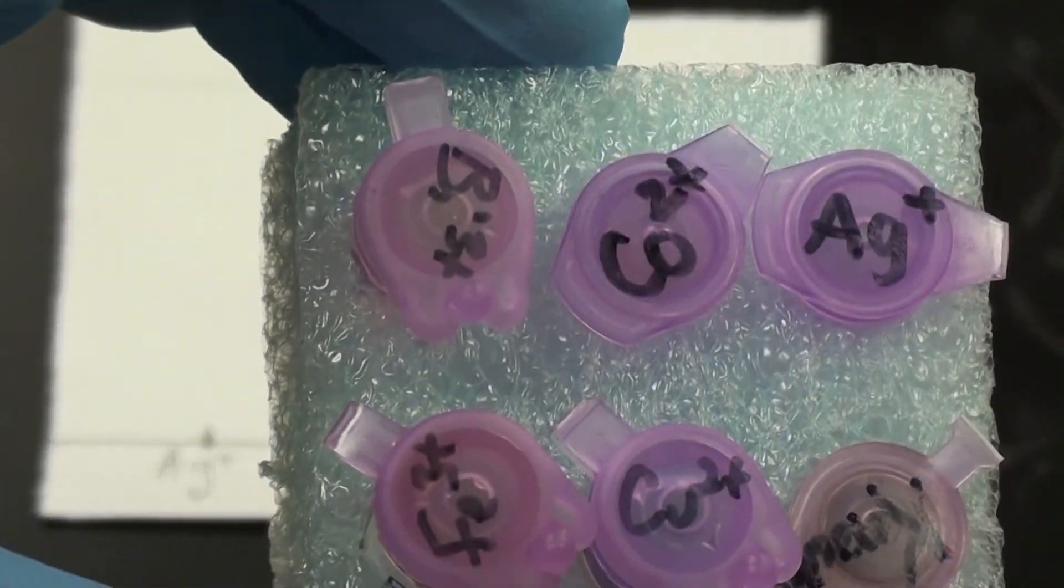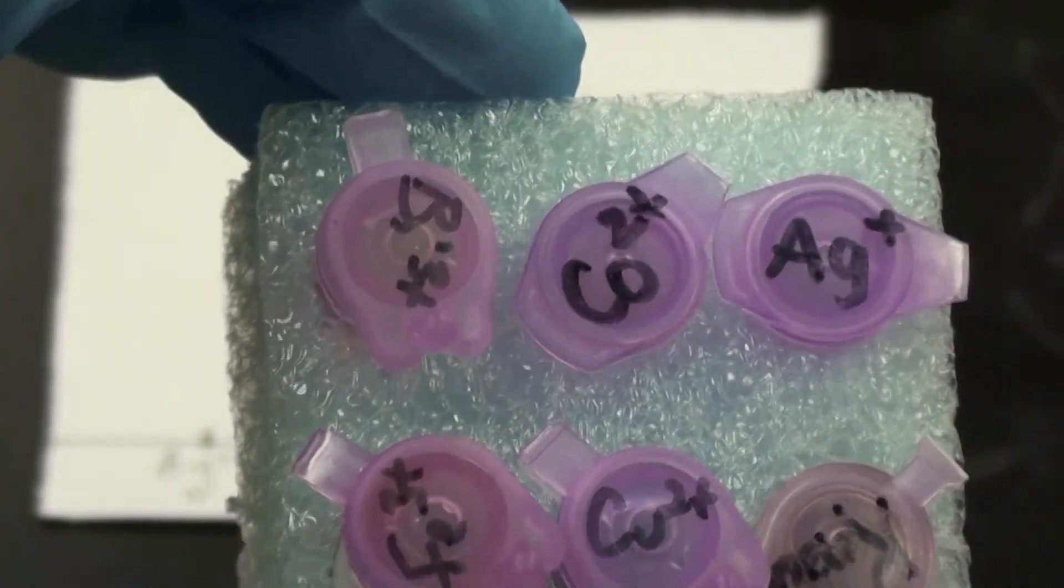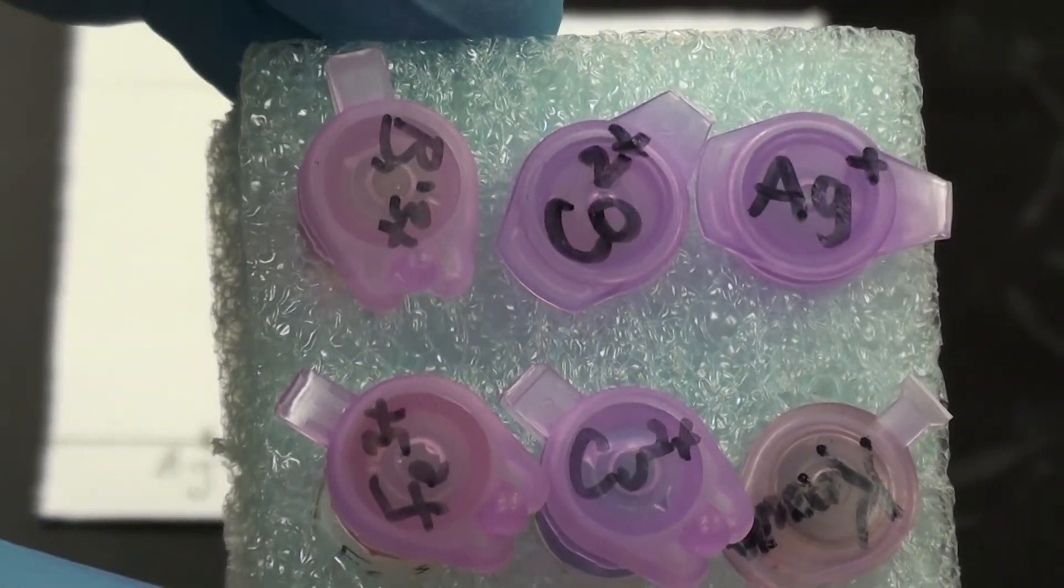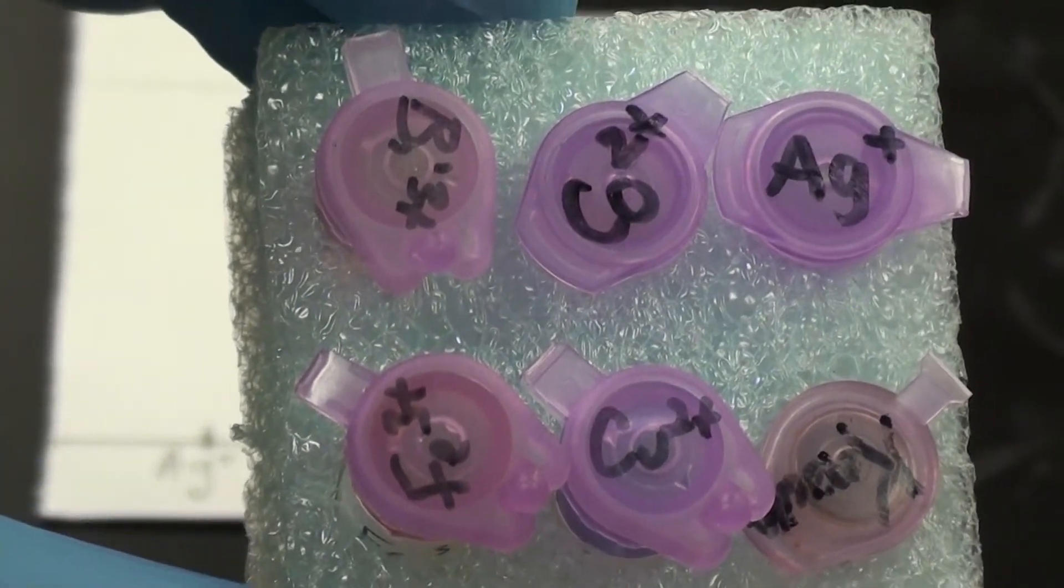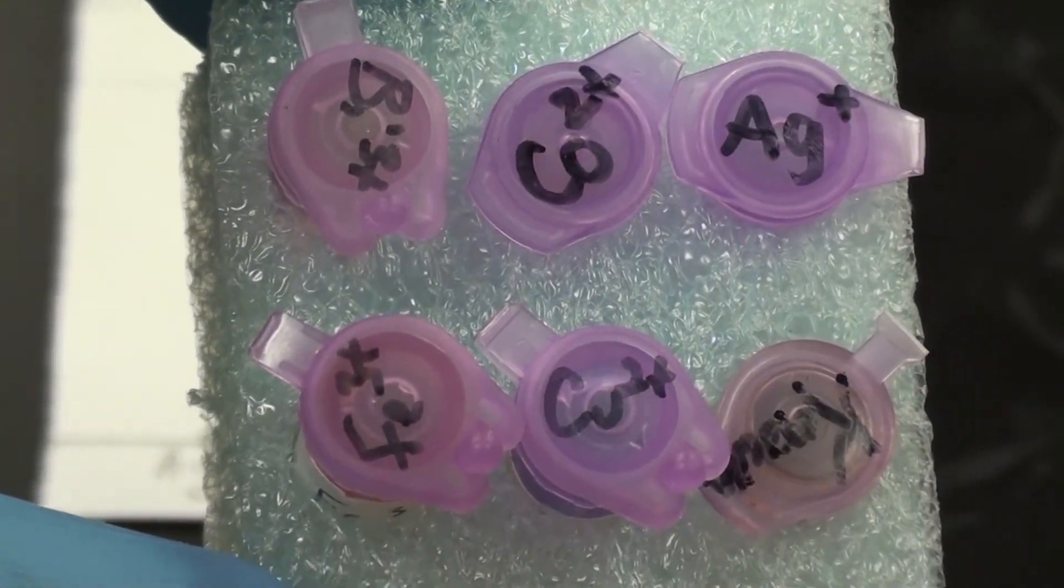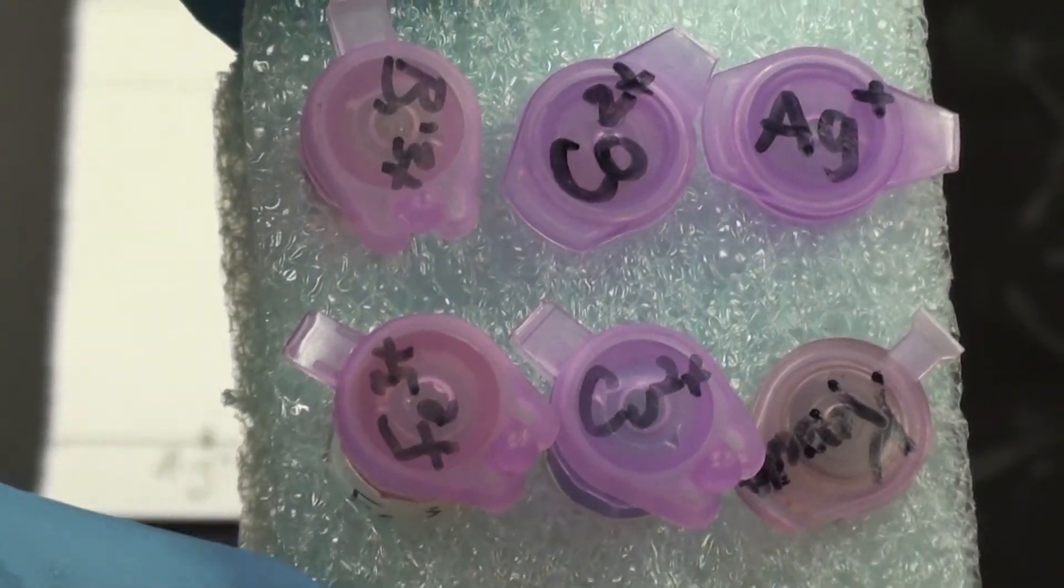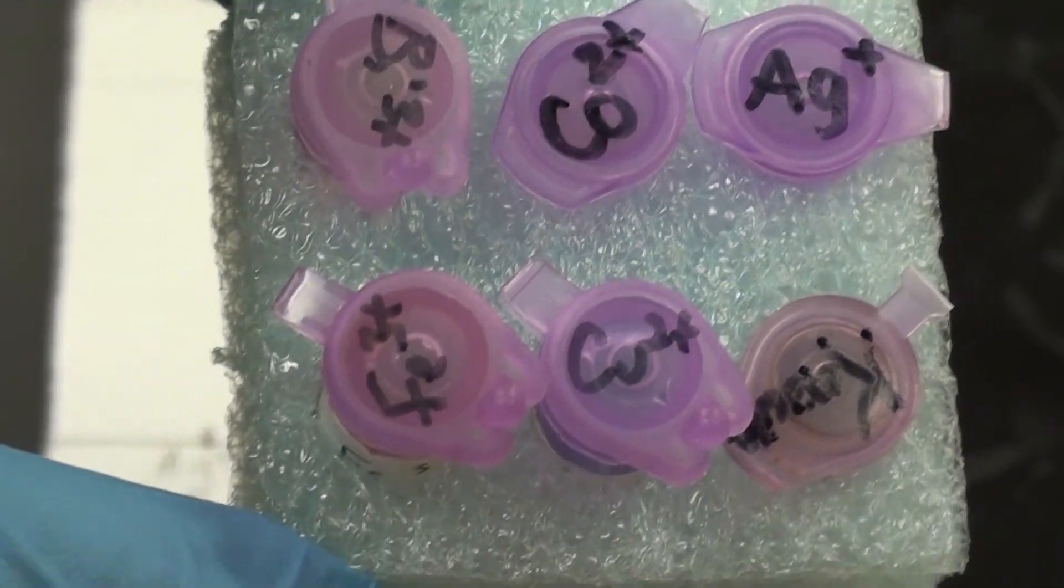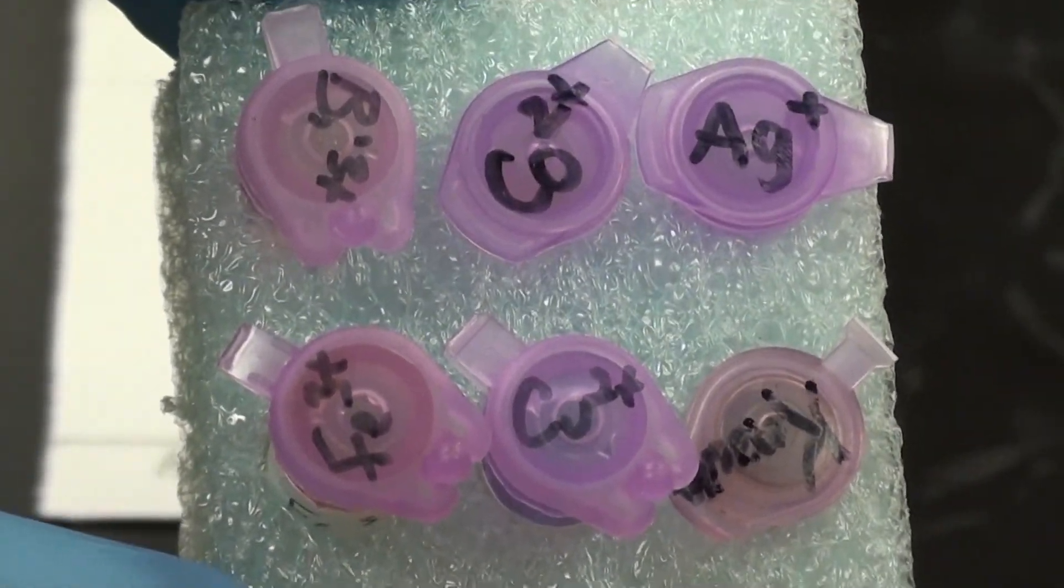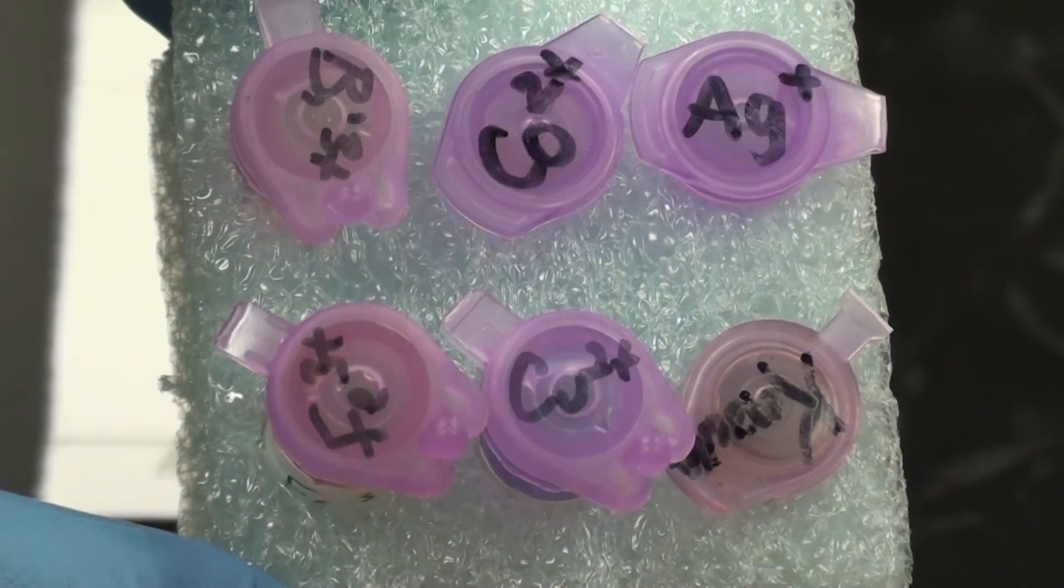Now you might be supplied samples in the micro test tubes, or you might be given micro test tubes which you'll have to label, and then you'll have to drop the ion samples into those first before you do anything. So that's going to depend on where you are. As you can see they're all labeled on top and that's very important.